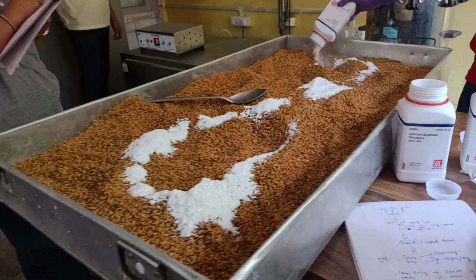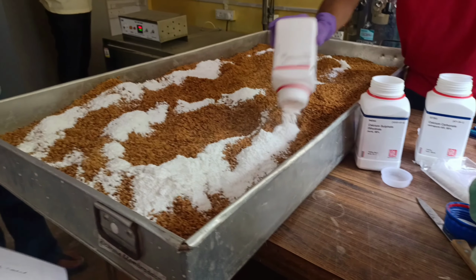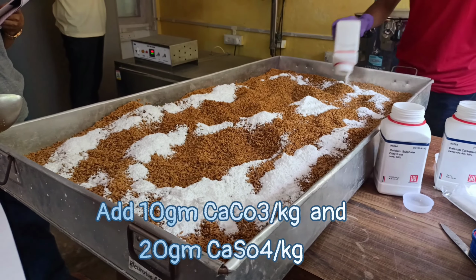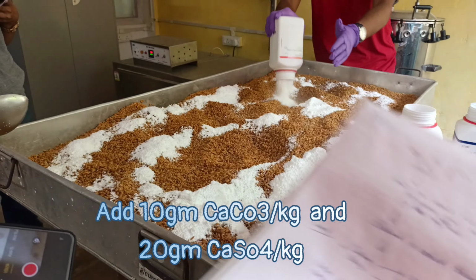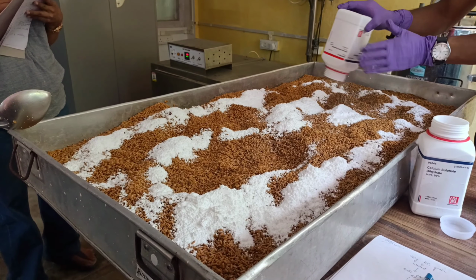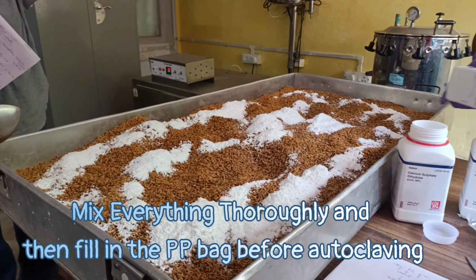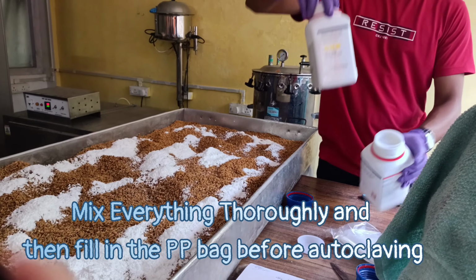After cooling down of the grains, now the next step is adding calcium sulfate and calcium carbonate, and then we're gonna mix everything thoroughly. We'll be taking 10 gram of calcium carbonate per kilogram and then 20 gram of calcium sulfate per kilogram, and then mix everything thoroughly and then fill it into the PP bag before autoclaving.